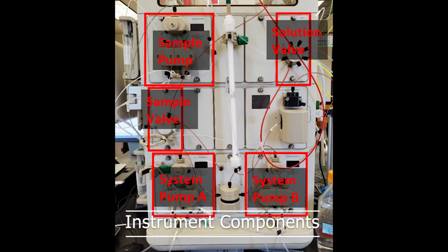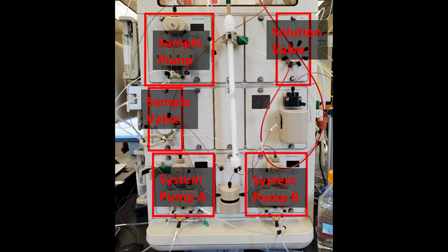Instrument components. Note the following instrument components. The sample pump controls repeated sample introduction from a reservoir. The solution valve controls what eluent is pumped. The sample valve controls the flow path of eluent through the instrument. System pump A is connected to only one bottle of eluent. System pump B is connected to the solution valve and can pump one selected eluent at a time.